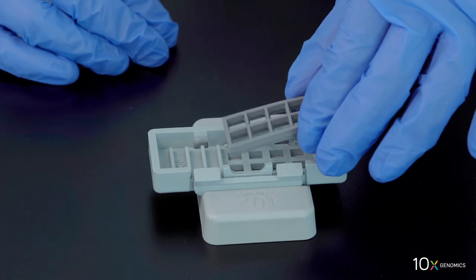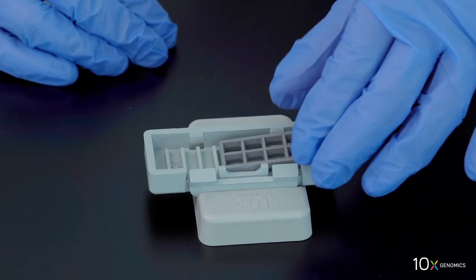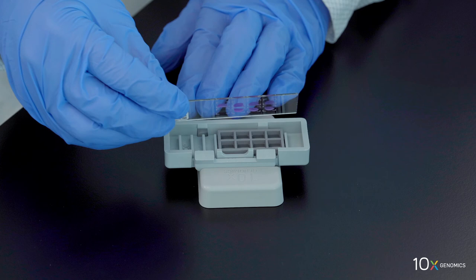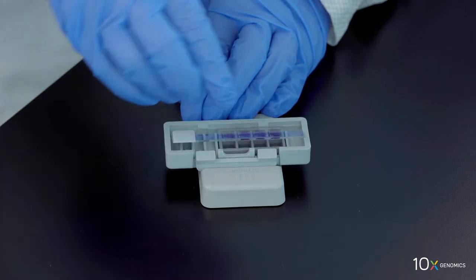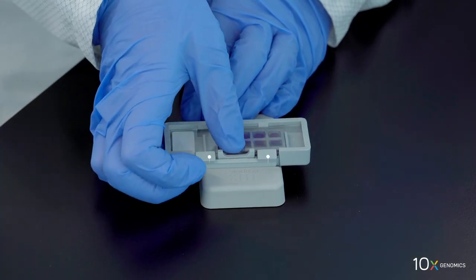Position the gasket to align with the slide cassette cutouts. Insert the long edge of the slide under tabs 1 and 2. Ensure that the slide is flush. Press the slide down until it is flush with the gasket and under tabs 3 and 4.